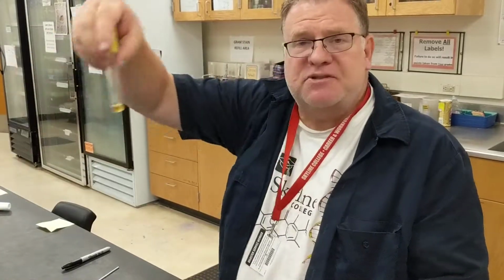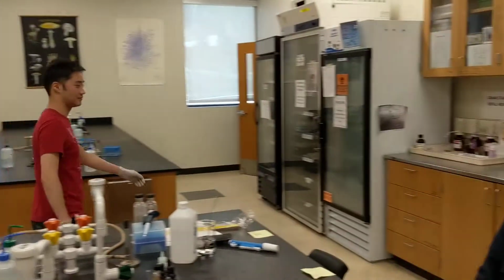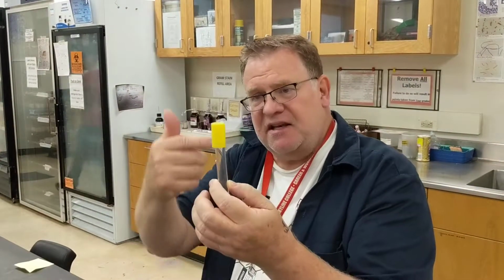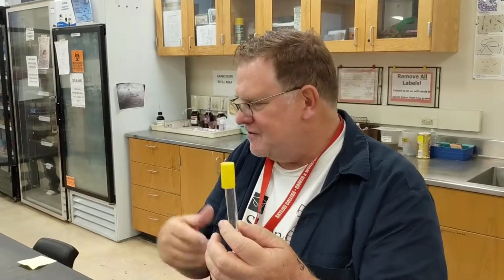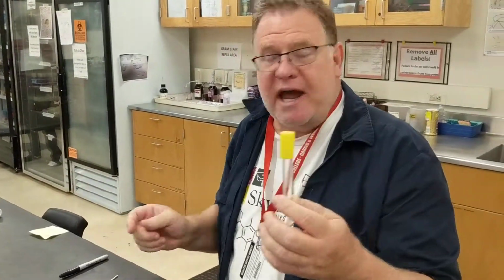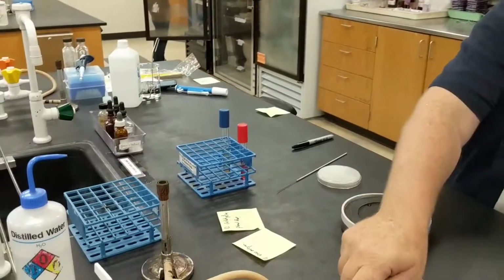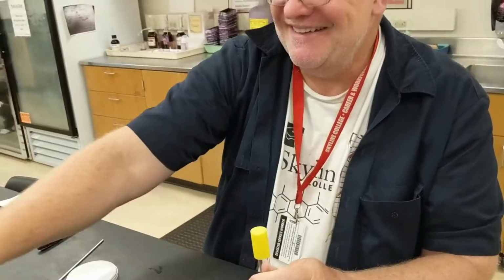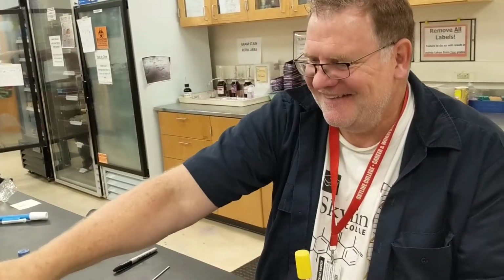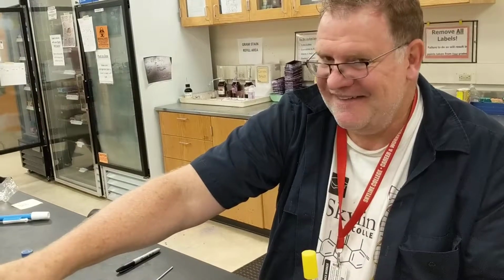And so I have a culture of Bacillus subtilis here. Gary's really good at making our cultures, and this is a little bit of Bacillus subtilis, and you notice it has the yellow top on it. A lot of your cultures, keep track of where the tops are and what they do. Oh, my flame is gone. Got the flame going. All right, so sorry about that.